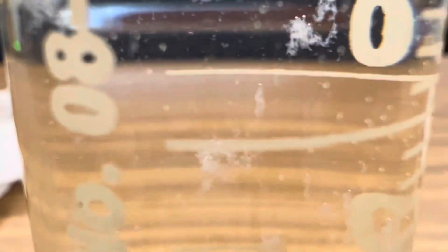Look how beautiful this precipitation reaction is. It is just amazing. Look at that. Just incredible.